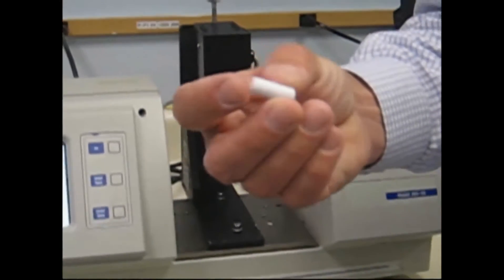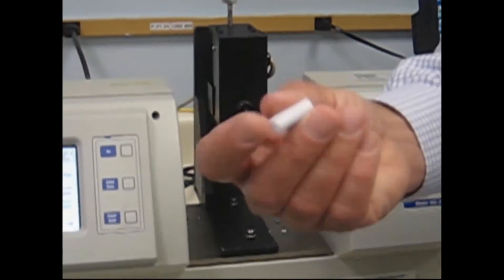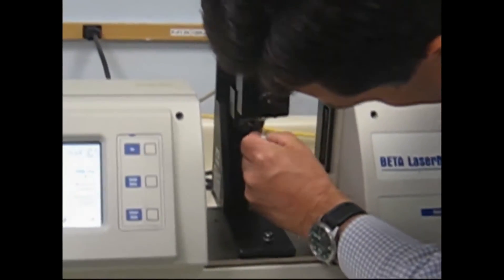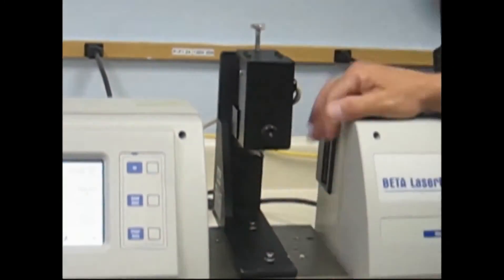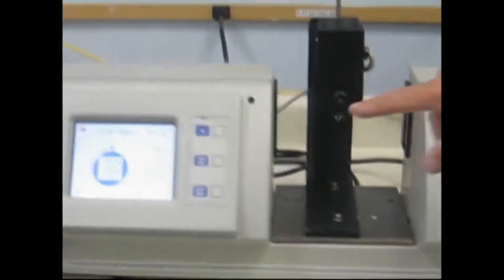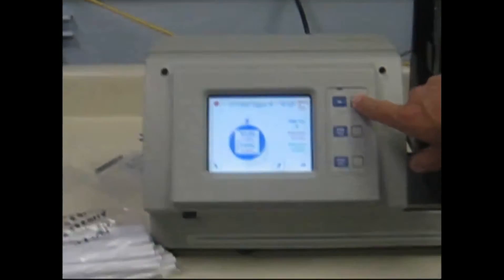Take your tube sample, no shorter than about three quarters to one inch, ideally about one inch is perfect. The sample positions onto the mandrel here, and is straddled by the two drive belts. You lift that up so you can see it. It comes down and drives it. There's a little bit of belt lap. We then press the go button to take a reading.